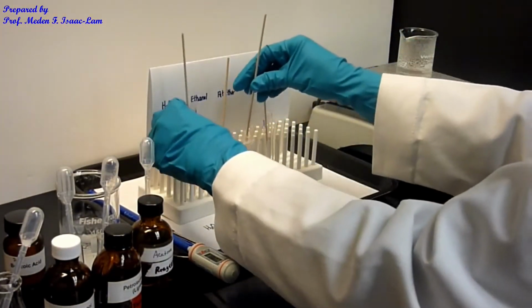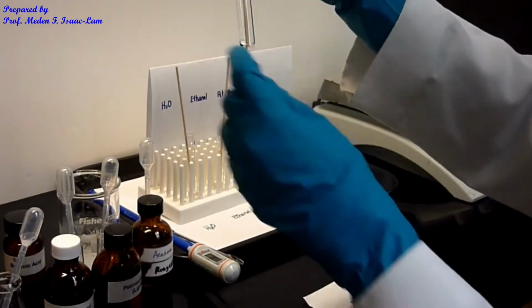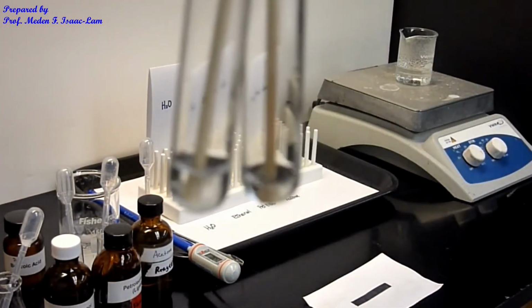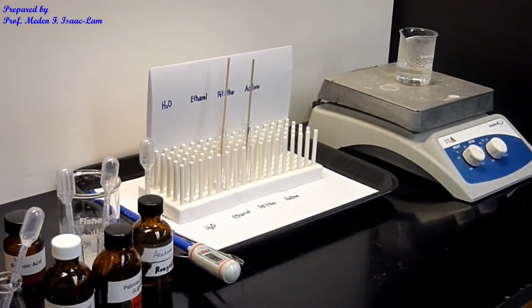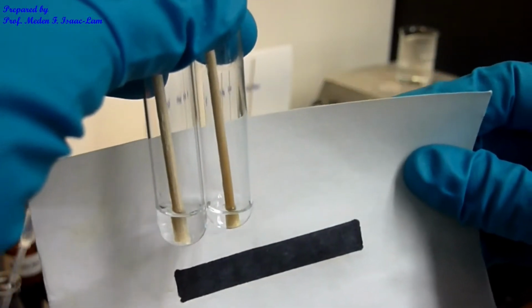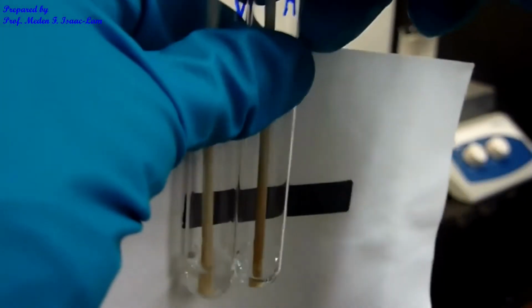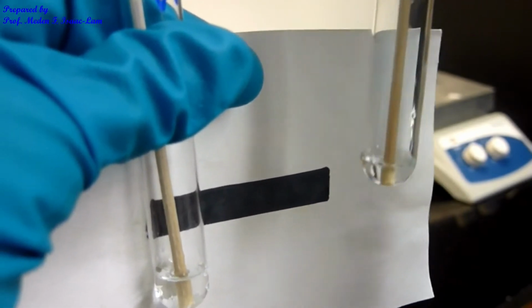So then we have acetone. Even though the height of the solvent is less, I don't really have to add it, just to save reagent. Acetone is A, on the right. It has less solvent because it evaporated some of it, but I don't see any particles at the bottom of this sample. So even though I'm not going to add any more, that means that this is soluble at room temperature.